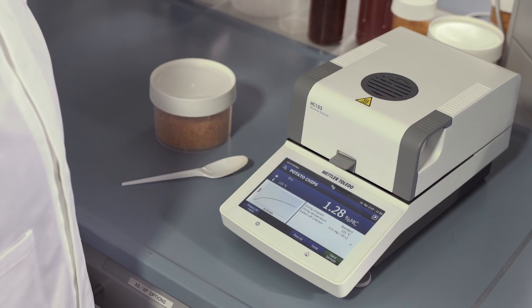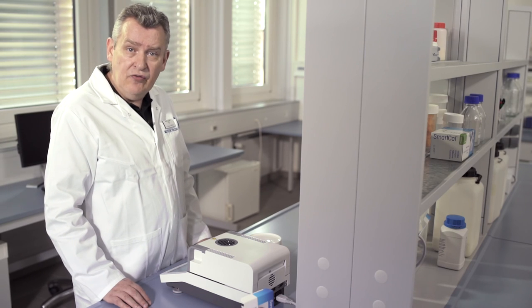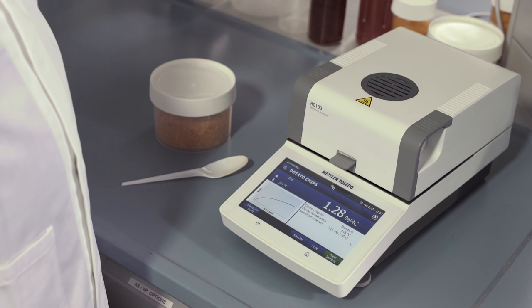An audible beep indicates that the measurement is completed, and the end result is displayed on the screen.